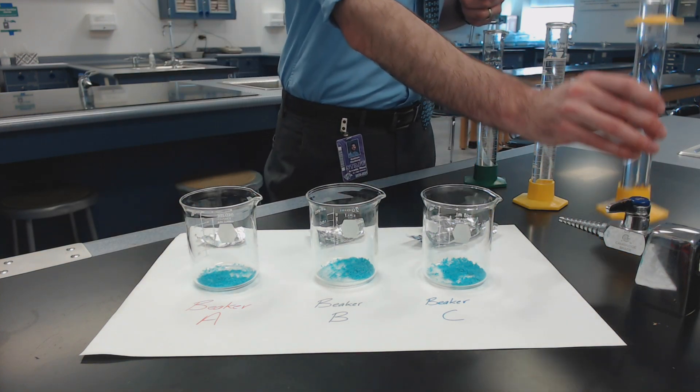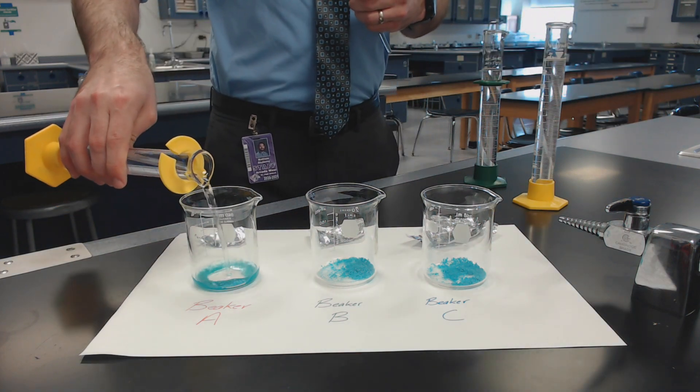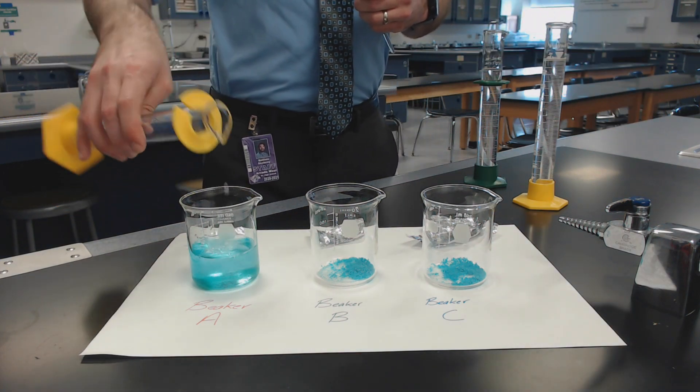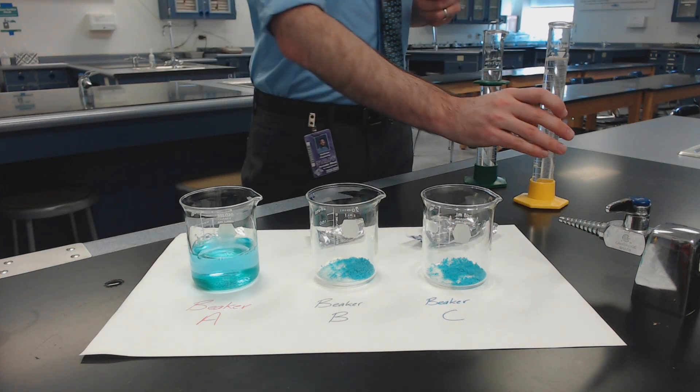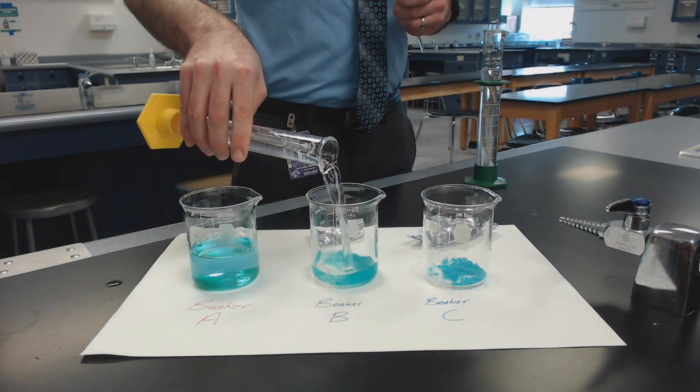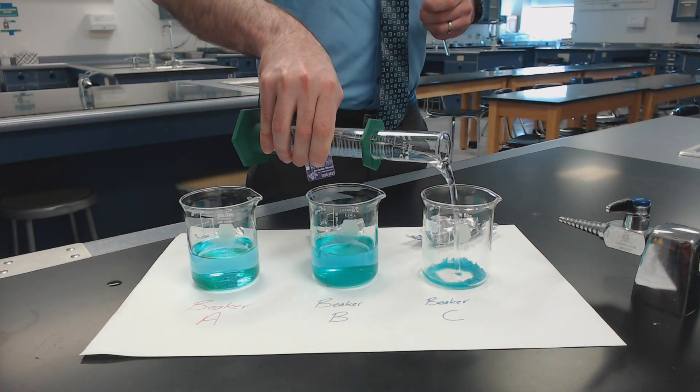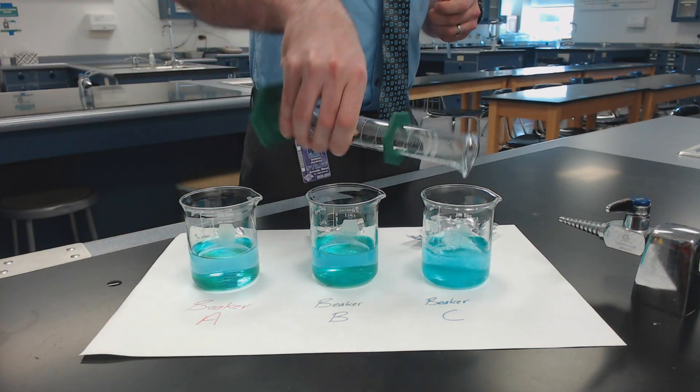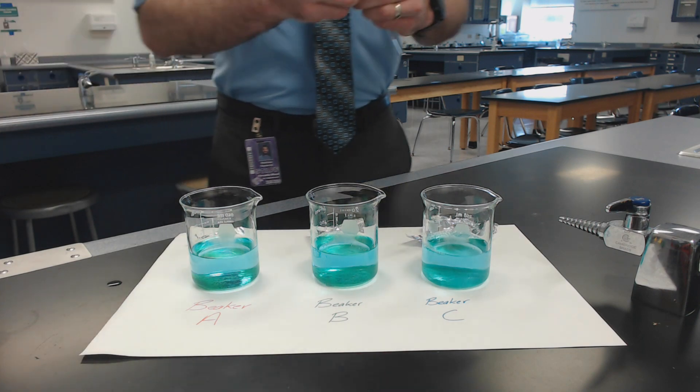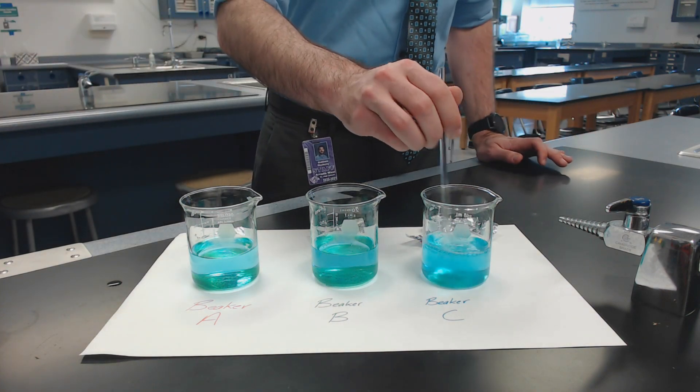I'm going to add 100 milliliters of water to each. So again, each of these beakers contain the same amount of the copper chloride.